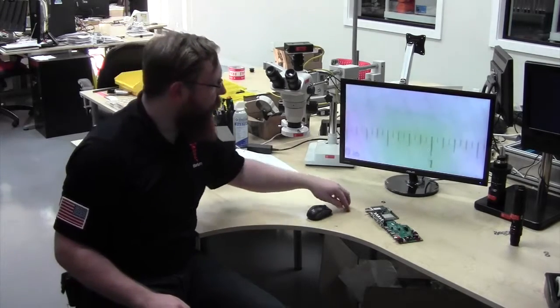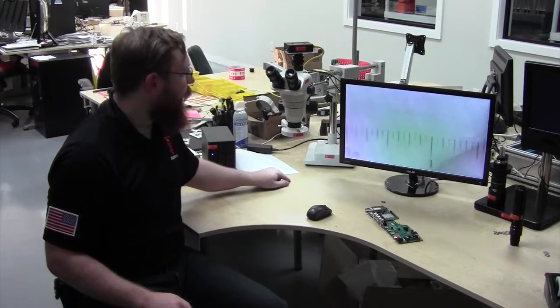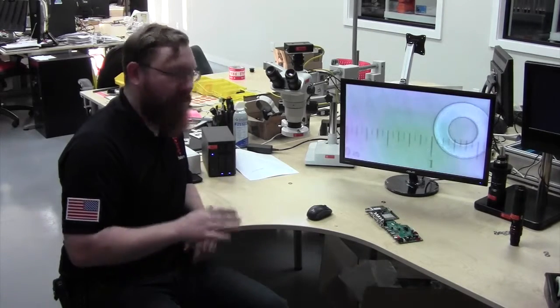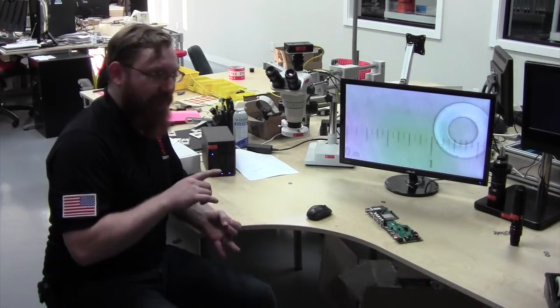It's there, it's on the image, and anything that you put into the frame, you'll have that ruler as an overlay. So you can use that to measure distances quickly and correctly every single time. No resetting a ruler every time. It'll save time and makes the job, whatever job that you're aiming towards, better quality and faster.